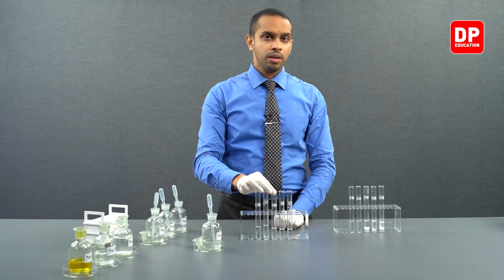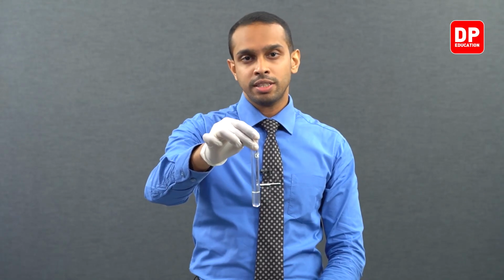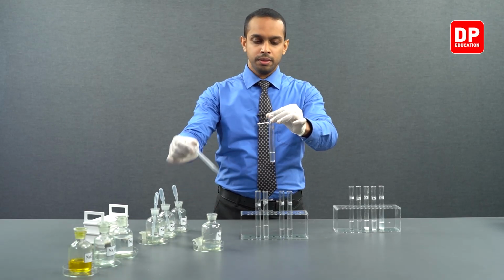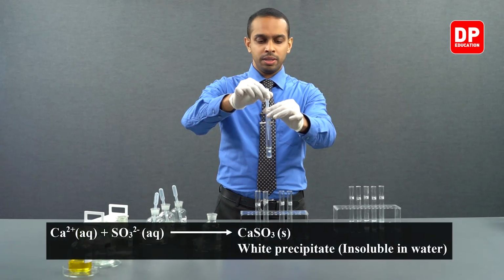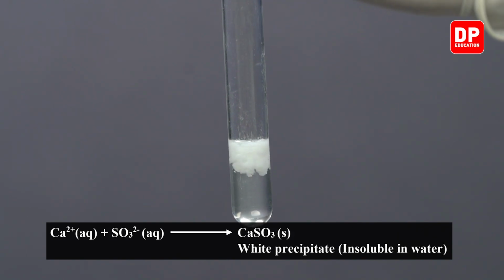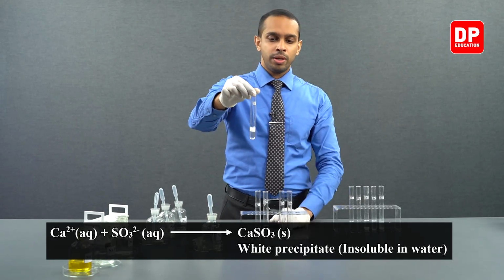Now, let's move on to calcium 2 plus aqueous ion solution, and let's add a small amount of sodium sulfite into this medium. You can see when sodium sulfite is added, it forms a white color precipitate.